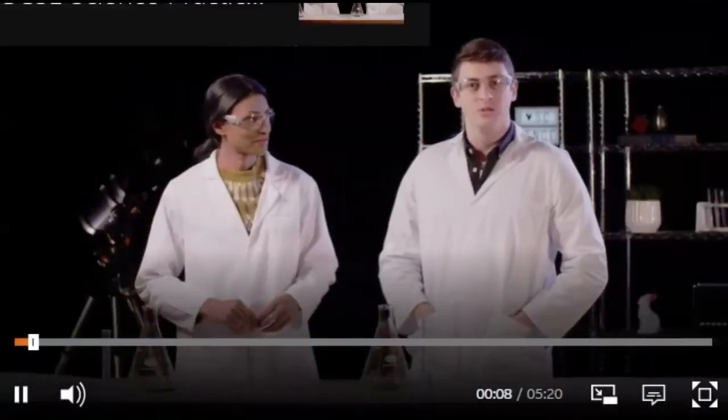We're going to show you the key skills you need when evaluating an investigation. And the investigation we're going to carry out is the reaction of hydrogen peroxide using a catalyst to produce oxygen and water. Now, this is sometimes called the elephant's toothpaste reaction, and you'll see why in just a second.